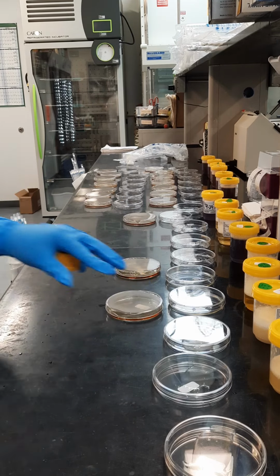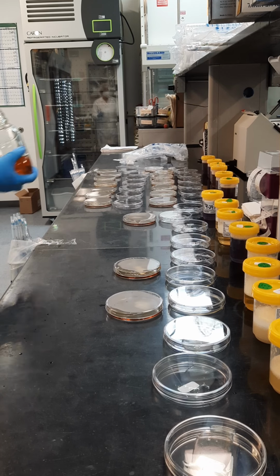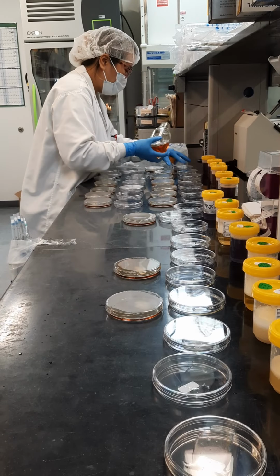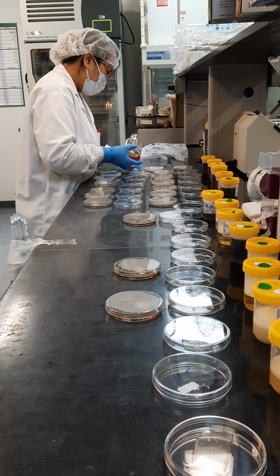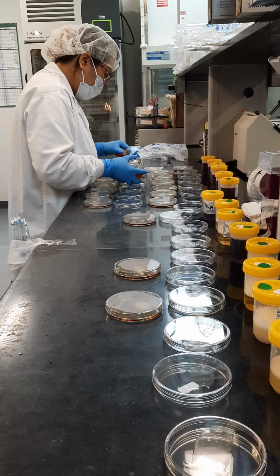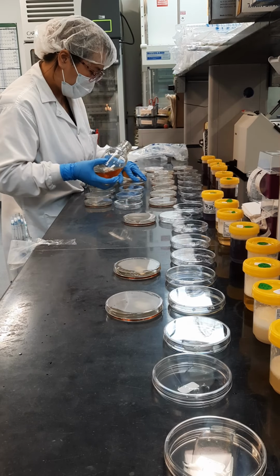As for swirling techniques, everyone has their own, and everyone also has their own aseptic techniques. With microbiology being a young field, there's still a lot of room for improvement and discoveries. So this is what works for me to get really good results. I'd say my aseptic technique is pretty good.